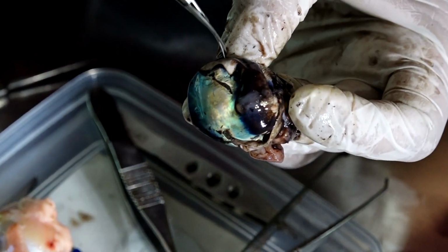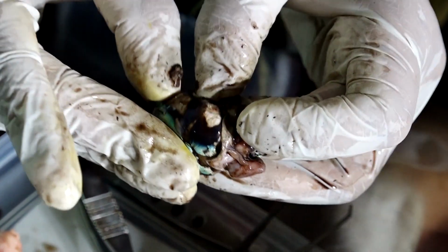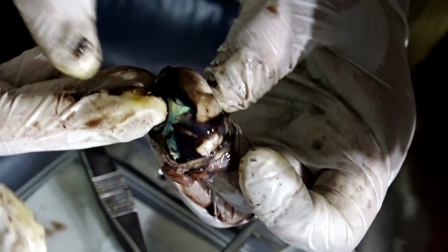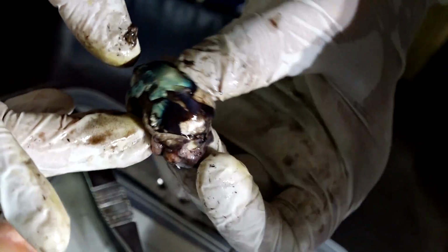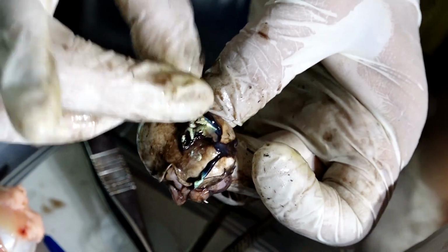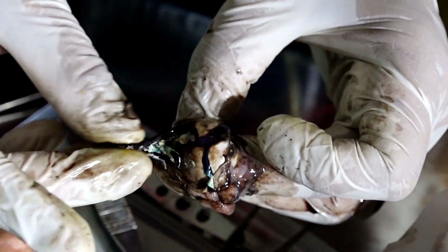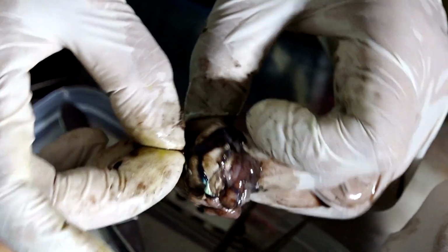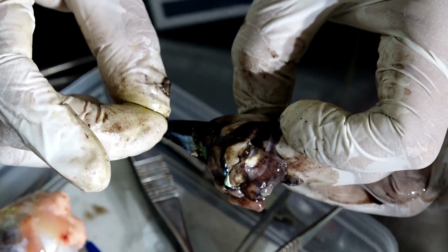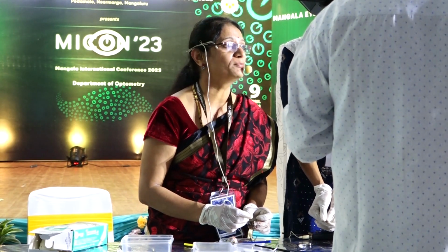Tooth forceps is also okay. See? It will be attached at the optic nerve, where the optic nerve leaves the eye. So this is all the retina. It's a very delicate structure. See, everything is coming close to the optic nerve, and this is where all the retinal nerve fibers come together and exit the eye in the form of optic nerve.